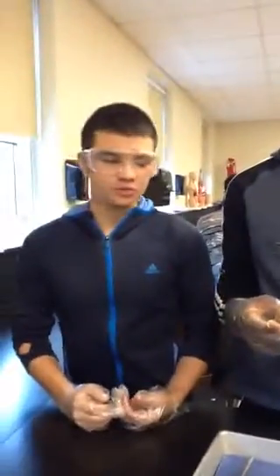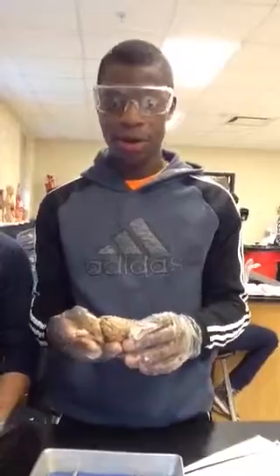Good morning and welcome to Anatomy and Physiology. I am Dr. Eddie Pacheco. Dr. Fernando. And today we are going to be pointing out certain parts of the sheep brain.